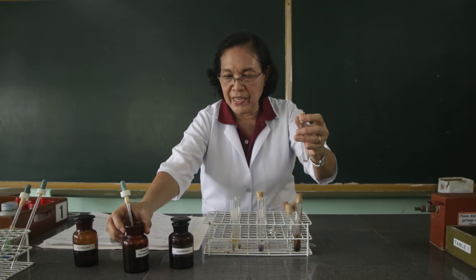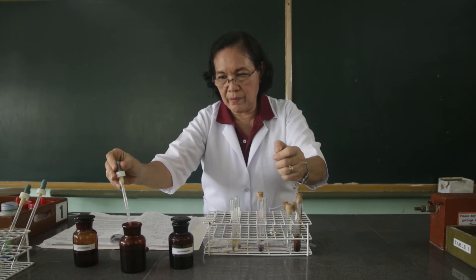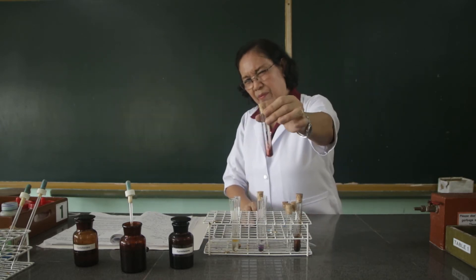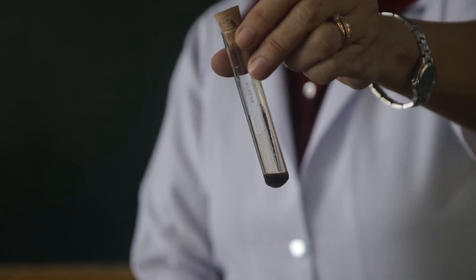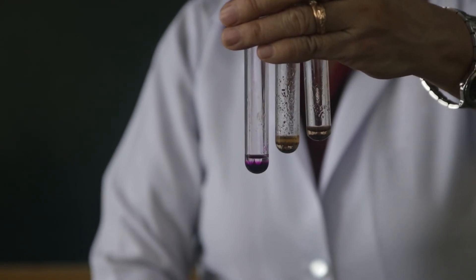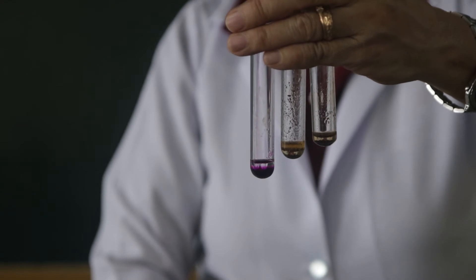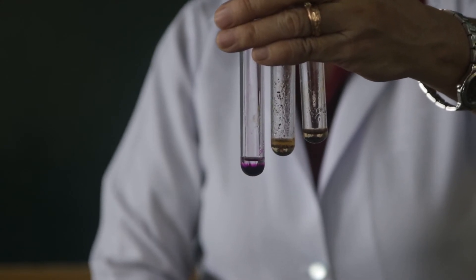Then with the acetylene gas, we are going to add this also with the potassium permanganate. Observe what happens. The test tube with the violet color is the cyclohexane added with potassium permanganate. The middle test tube is the cyclohexene added with potassium permanganate, and the third test tube is the acetylene gas added with potassium permanganate. Compare the three.